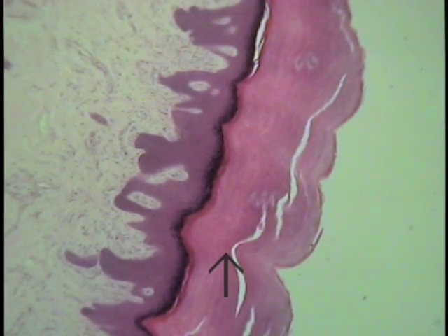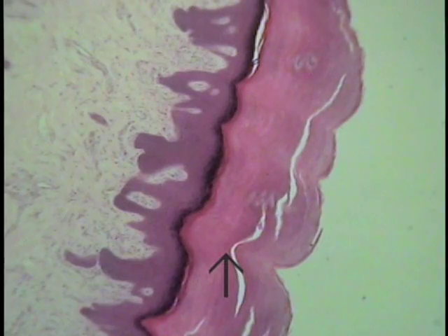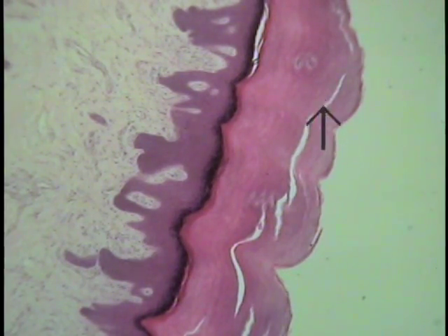This is a section through thick skin, skin that was taken from either the palms of the hands or the soles of the feet. It is another form of keratinized, stratified squamous epithelium. This huge mass of structureless material, as indicated by the pointer, is keratin. If one envisions the palm of their hand and the development of a callus, this is that thick keratin type of material forming that type of callus. So this is all keratin.